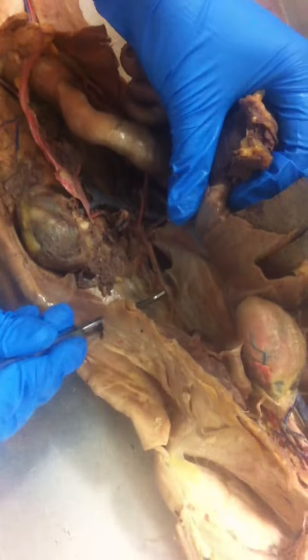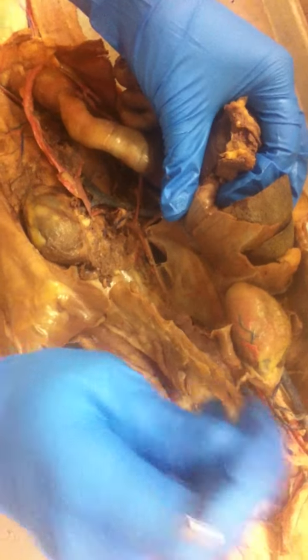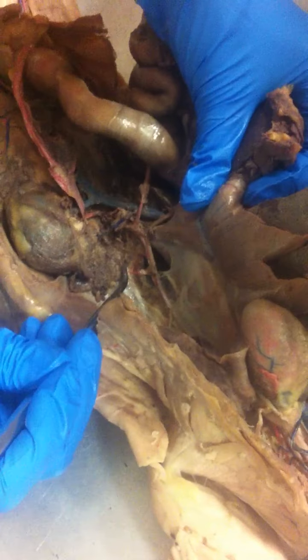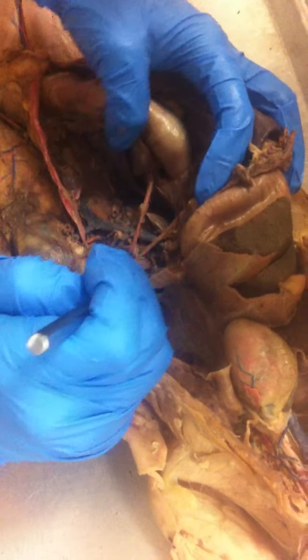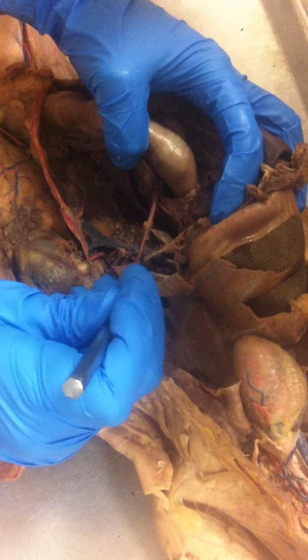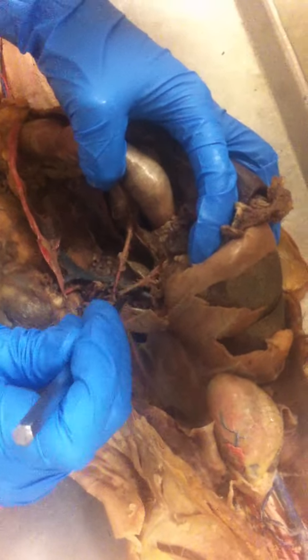Okay. You then have your descending aorta, which comes off of the aortic arch and continues down the back. You have your lumbar arteries, very thin, that are going to the vertebrae. Your first branch that you need to know anyways is your celiac trunk. Off of that, you have three other branches.